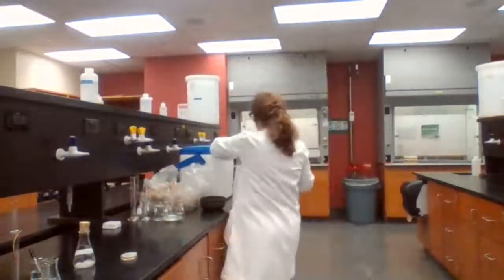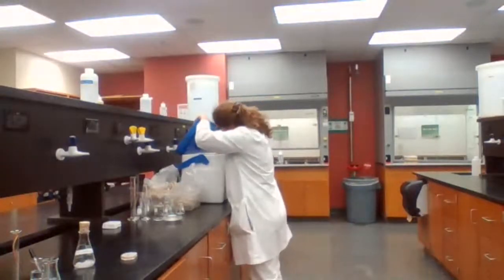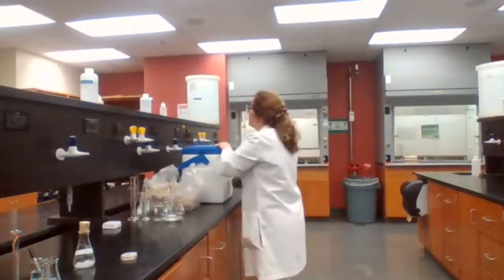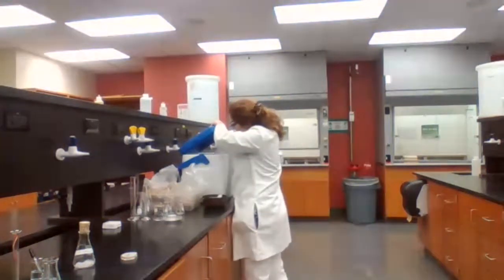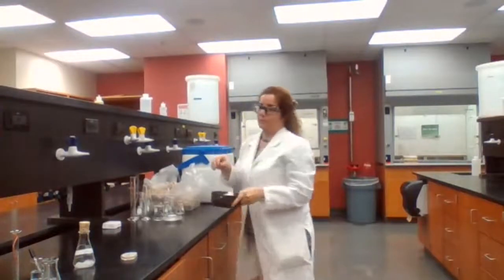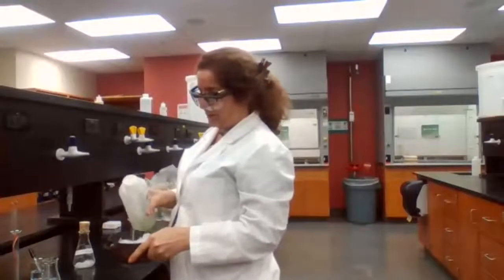I have to place an ice bath. And I need the ice water. I have ice and the water.